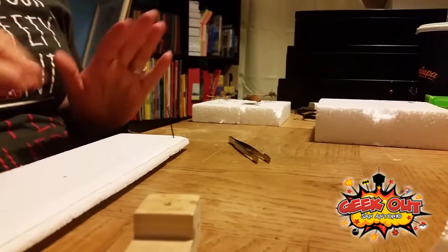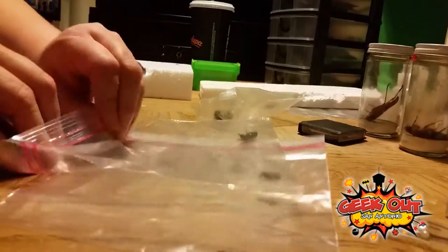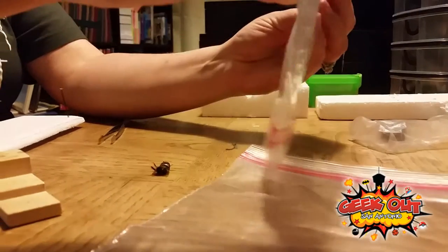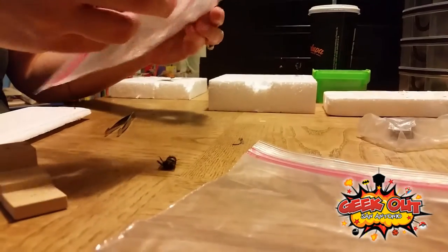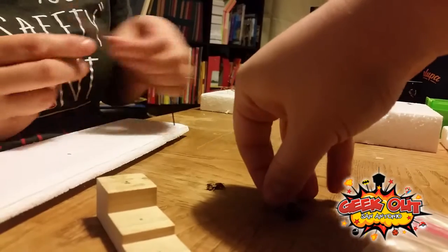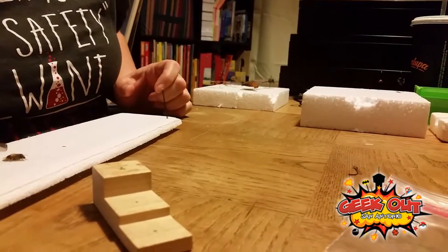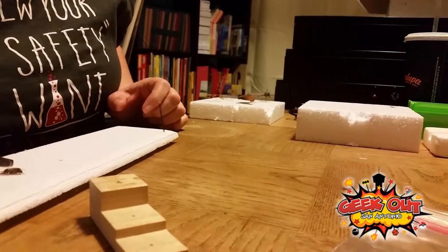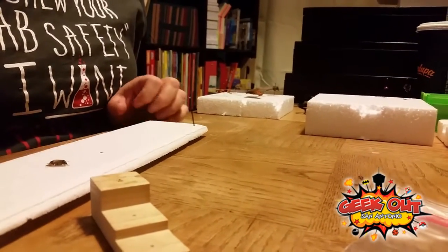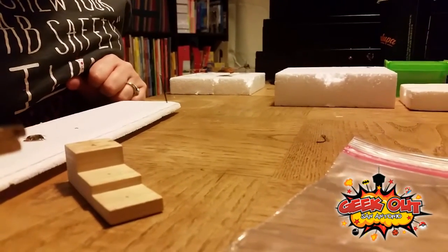Next I have two bees. The honeybee's not in great condition, but the bumblebee looks really good so you can probably pin that one. I didn't know I was squishing them in the baggies, so I didn't do a great job with these initial bugs — but as we go I'll get better. Pro tip: never put insects in baggies.